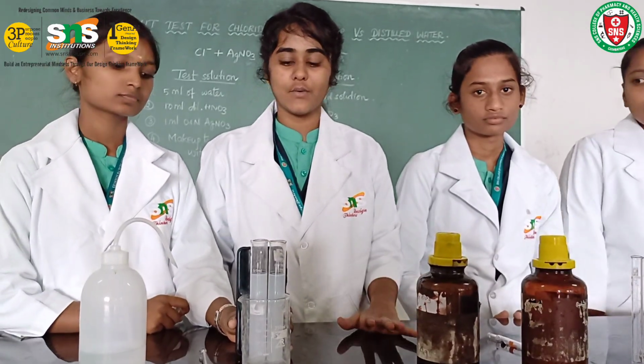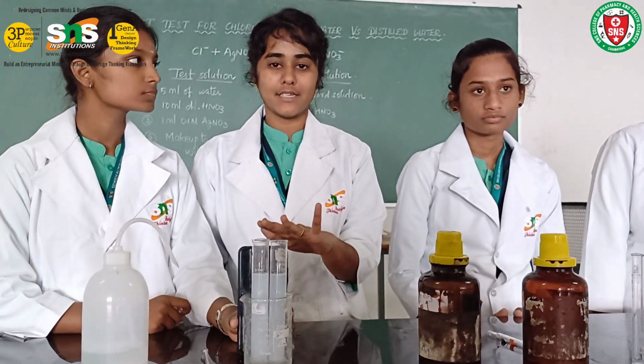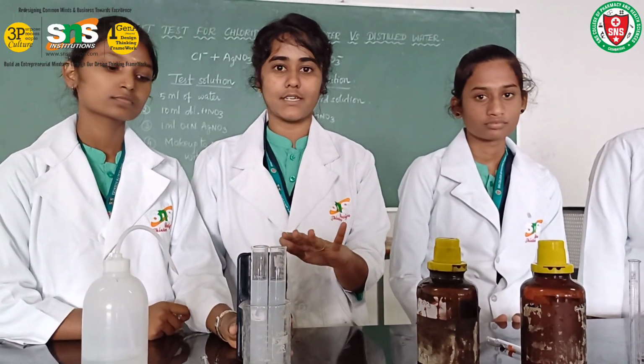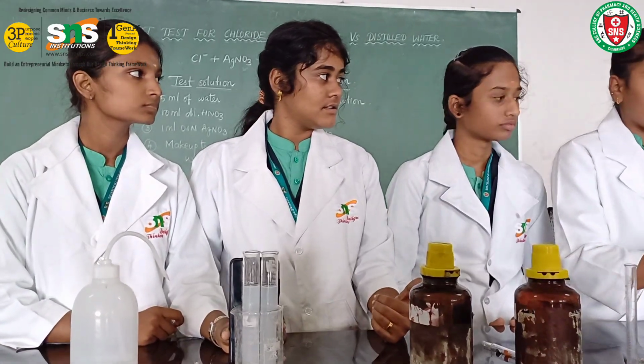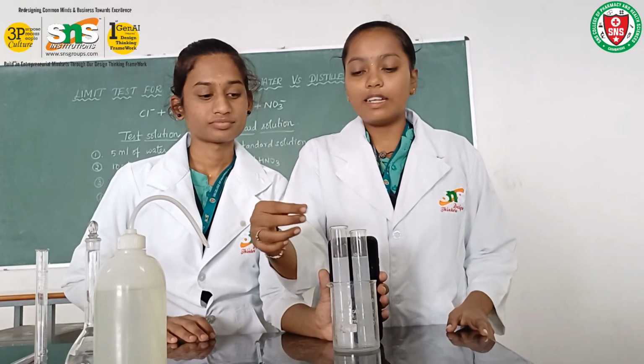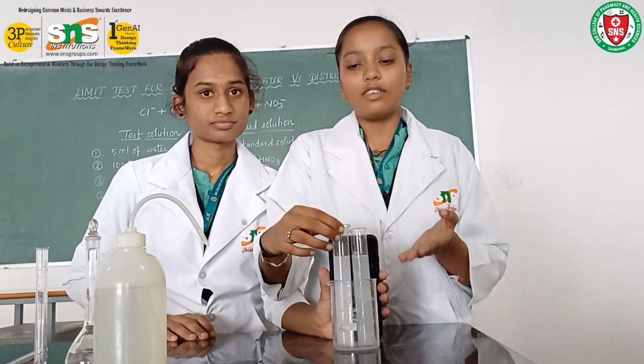For distilled water, the test solution has less turbidity than the standard solution, so it passes the test. But for the tap water, the test solution has higher turbidity than the standard solution, so it failed the test.